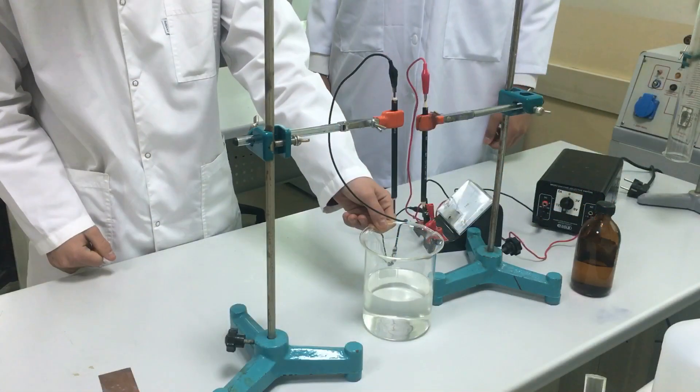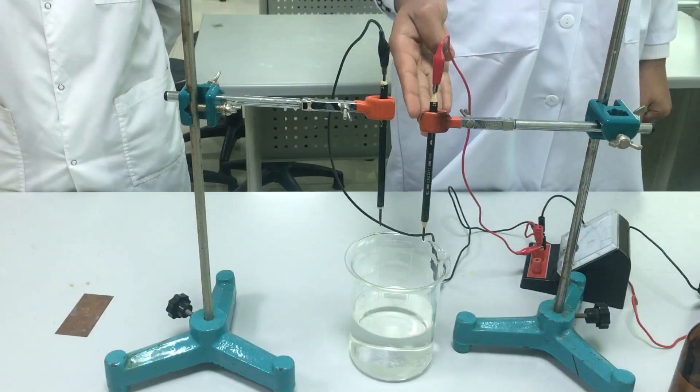Here we have a brine solution. Now we are going to put the electrodes in the solution.